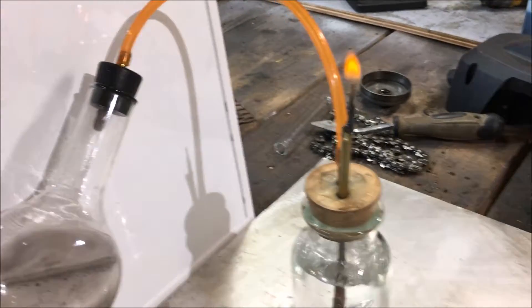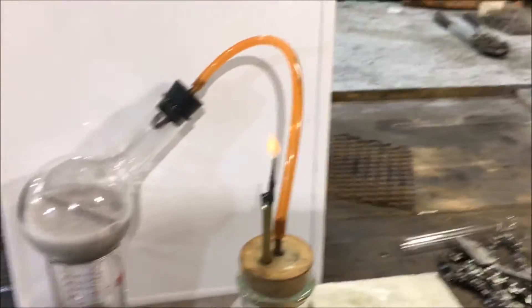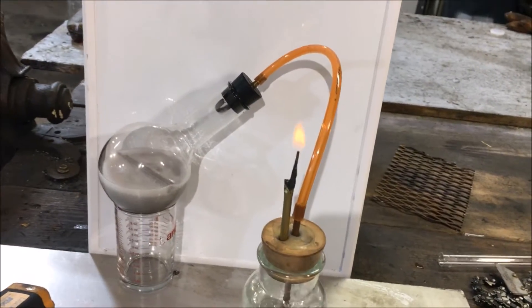It's not killing me this time, which is awesome. That was incredibly frightening lighting that up. Now that the flare is lit, I can monitor it a lot safer.